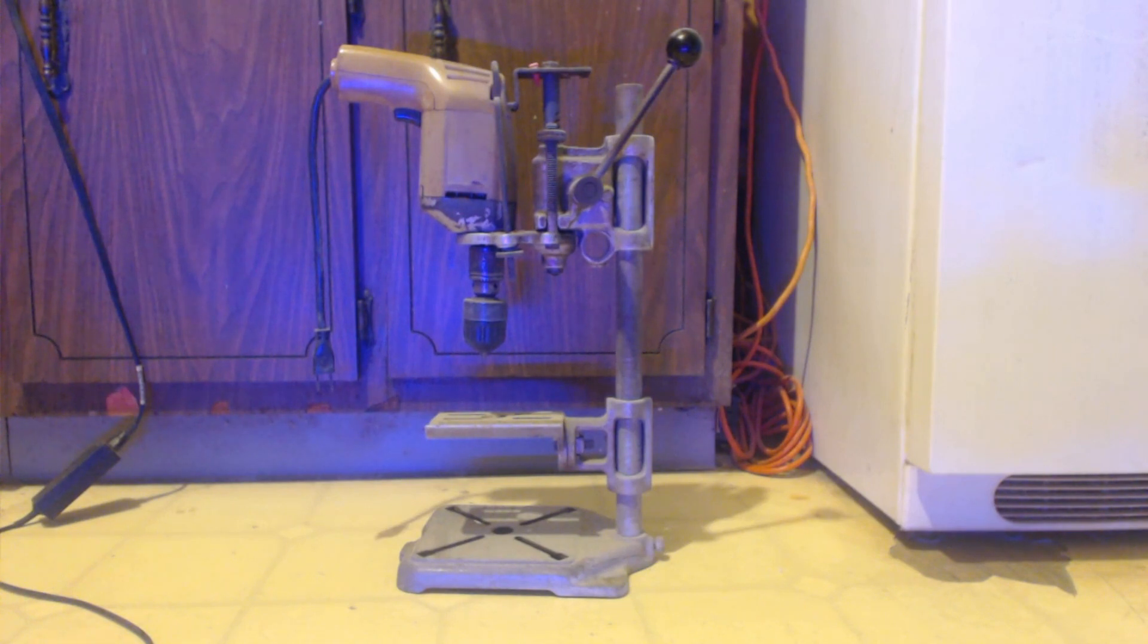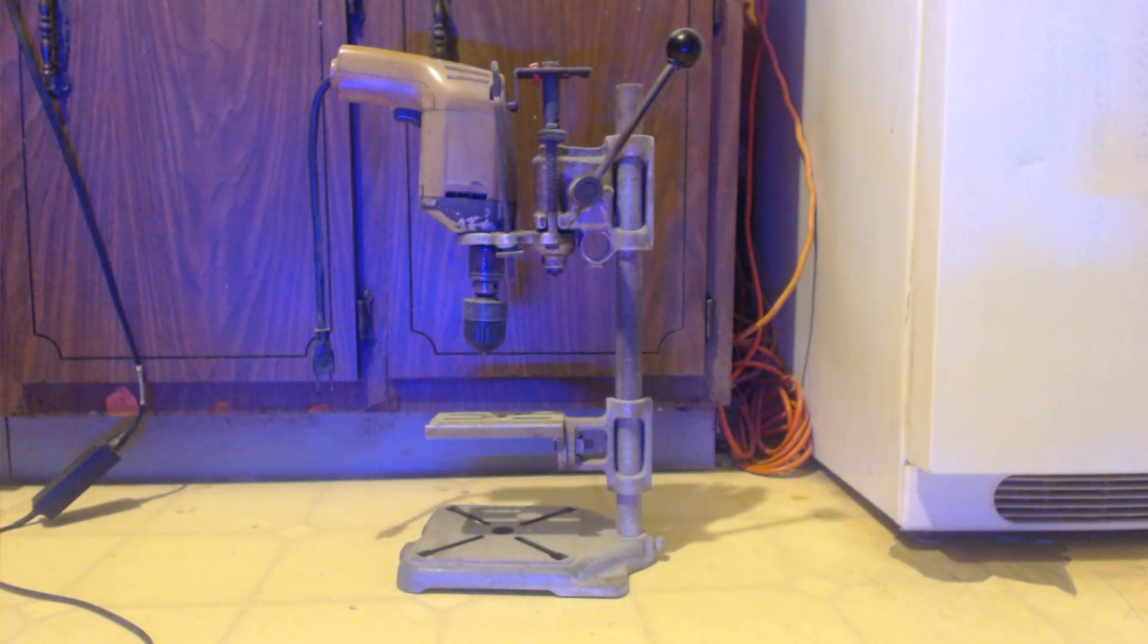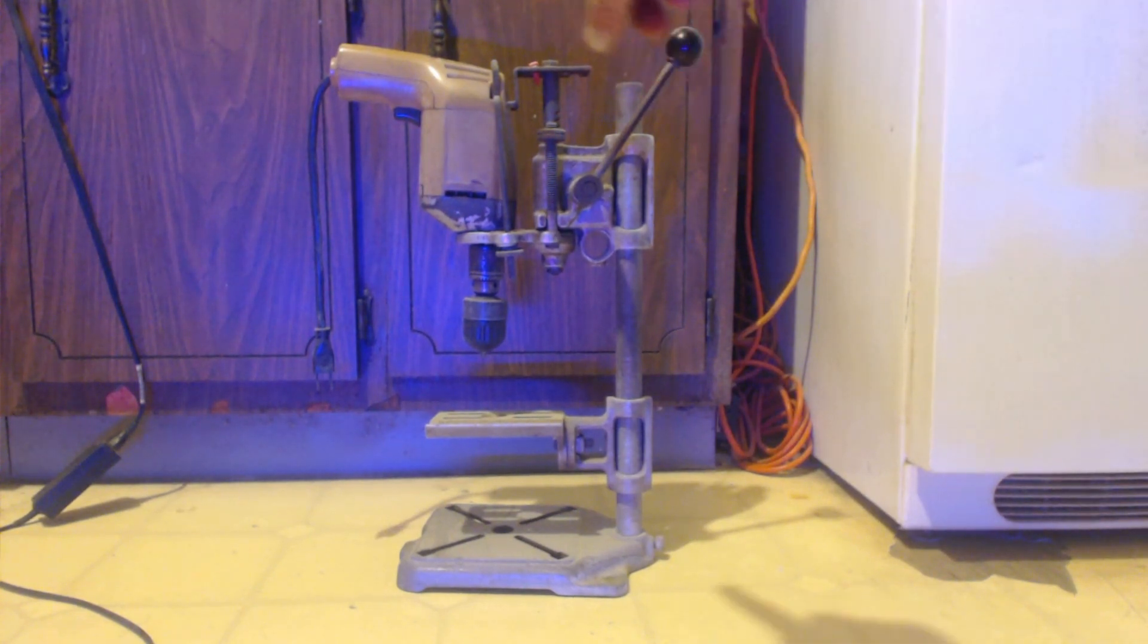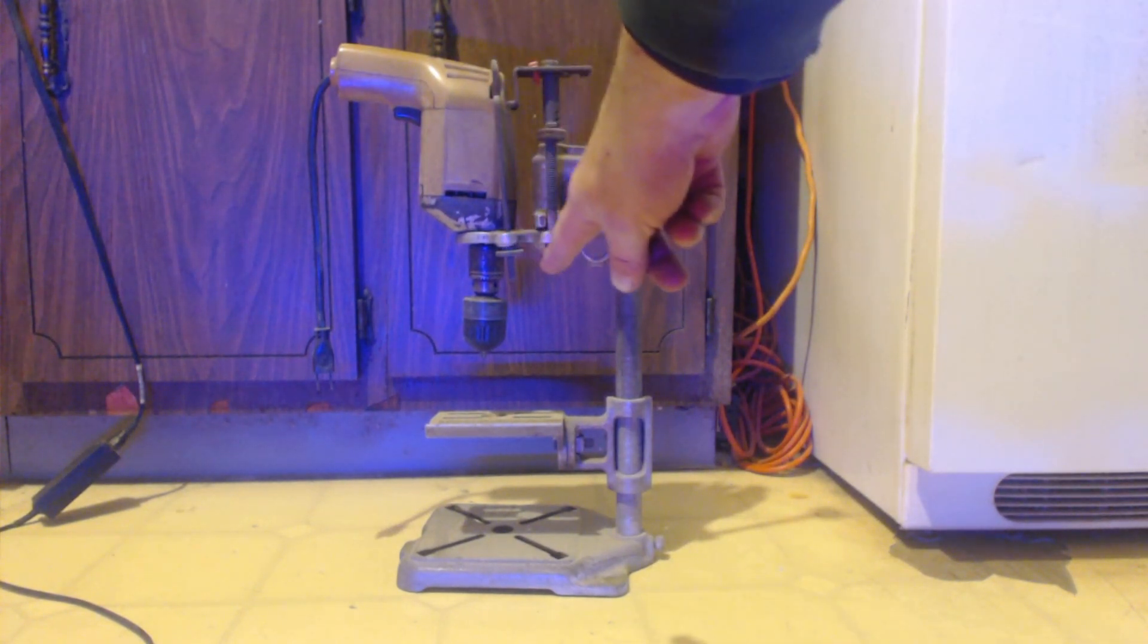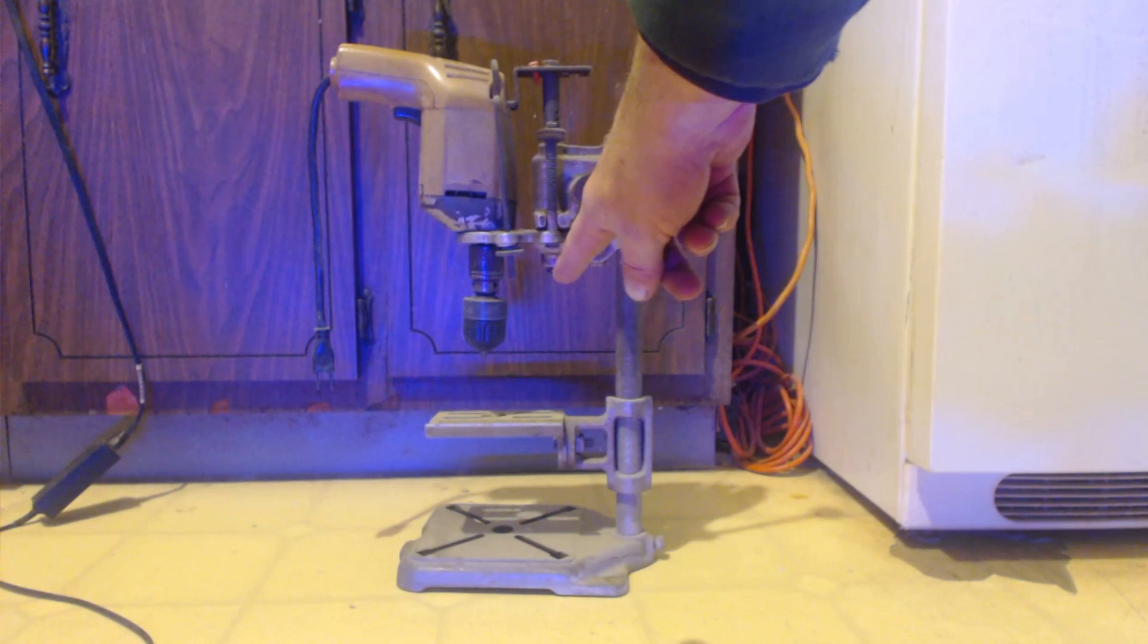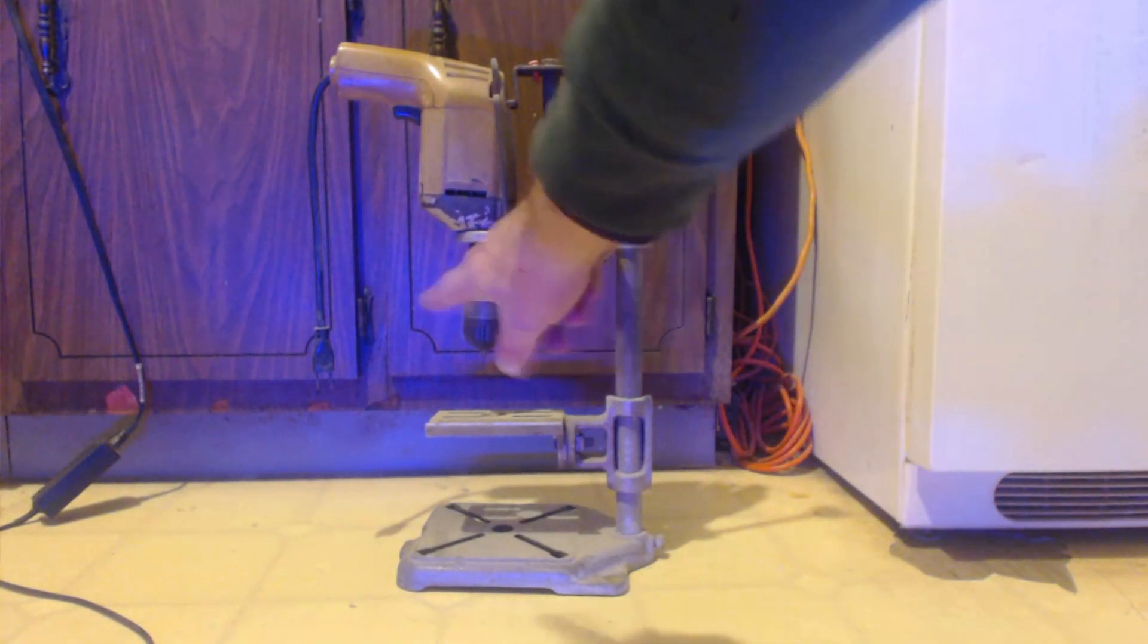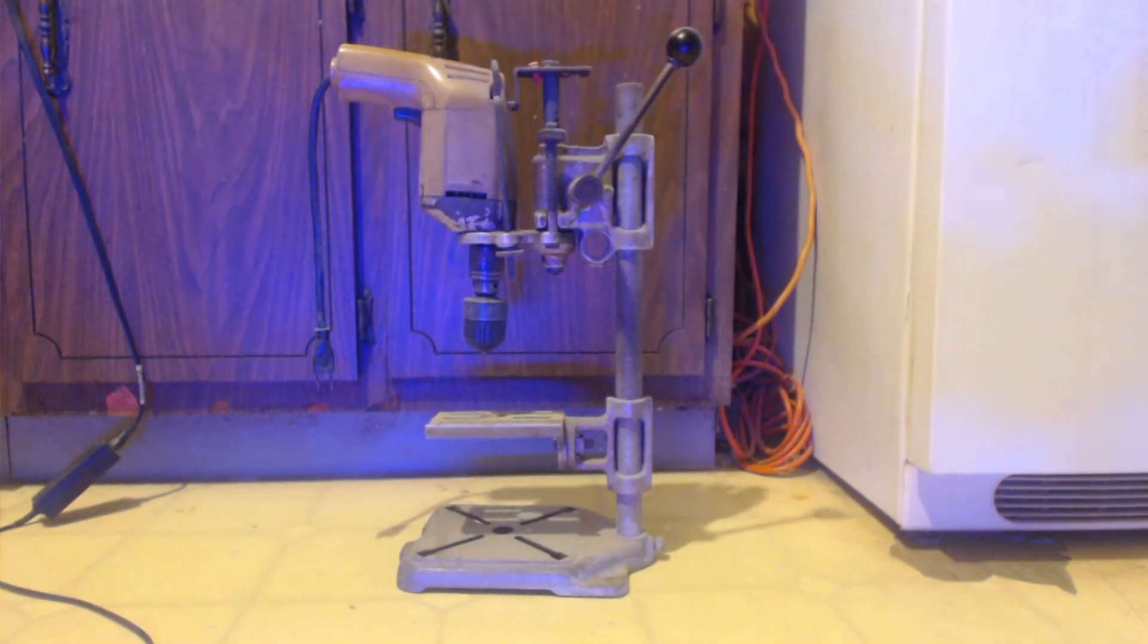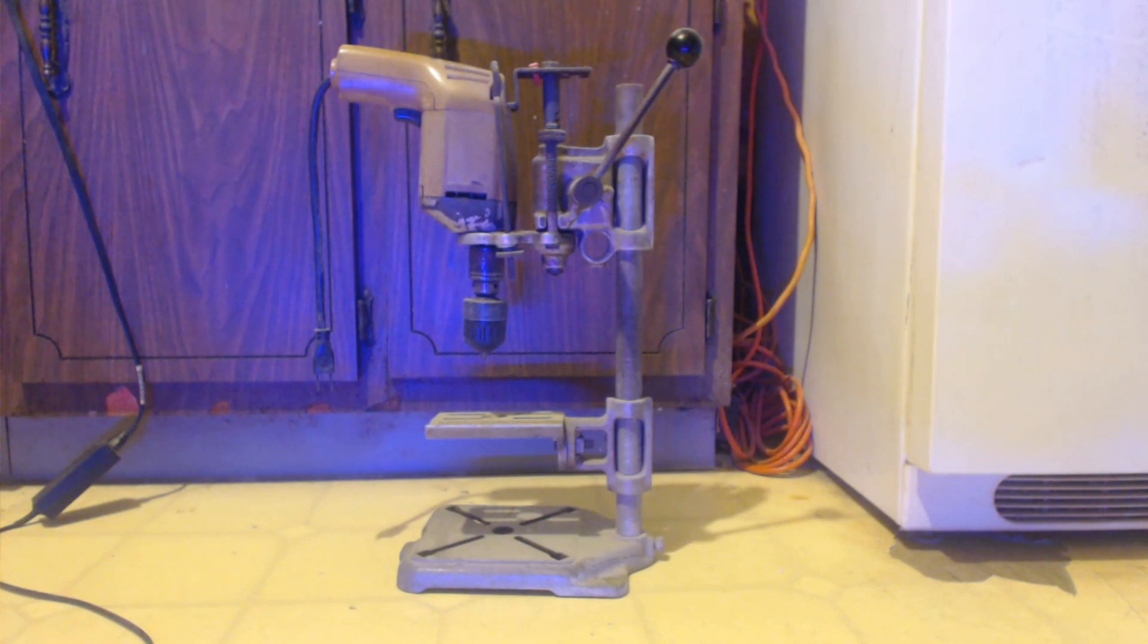This guy, he actually built this, so they put a clamp there. I can actually take that off, you know, that platform there to get it out of the way and it'd be ready for use.